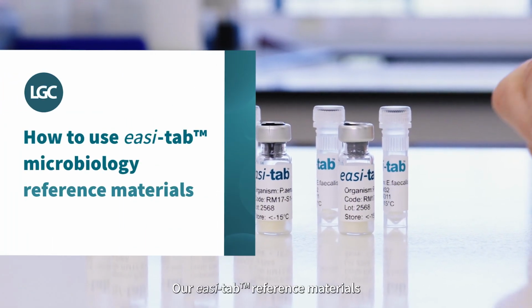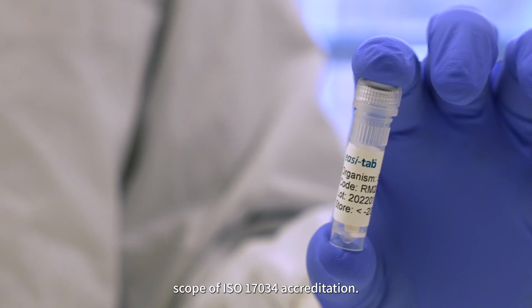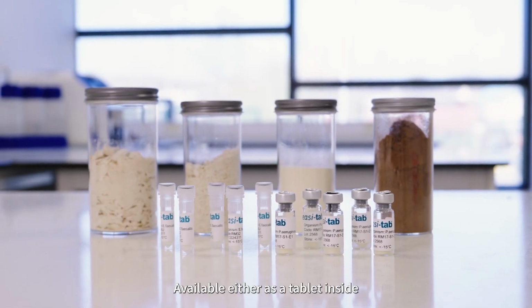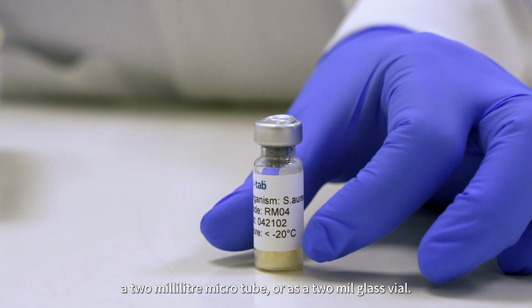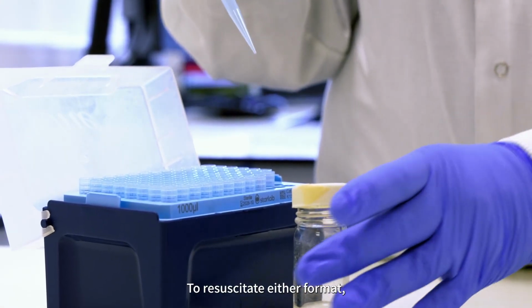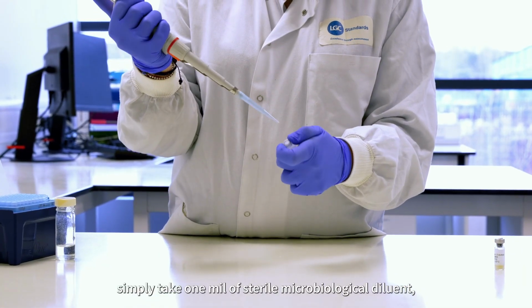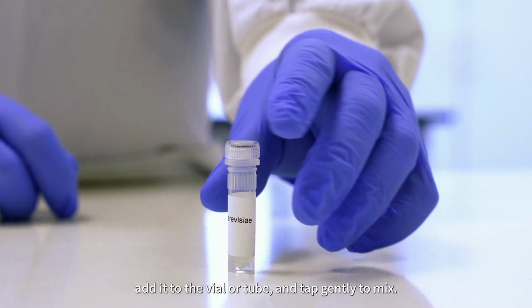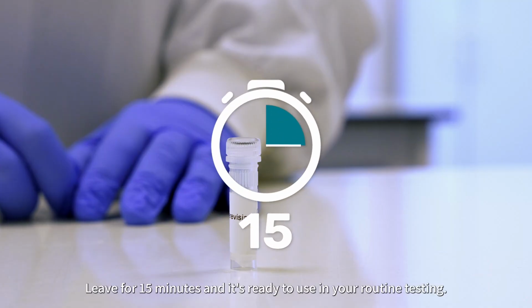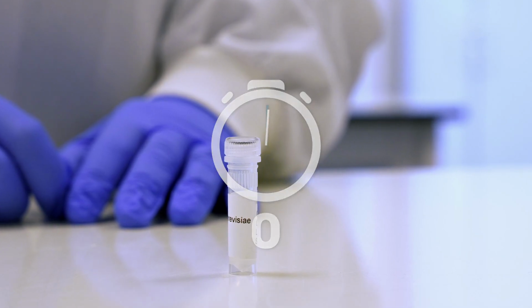Our easi-tab reference materials are lyophilised microorganisms produced under LGC's scope of ISO 17034 accreditation, available either as a tablet inside a 2 ml microtube or as a 2 ml glass vial. To resuscitate either format, simply take 1 ml of sterile microbiological diluent, add it to the vial or tube, and tap gently to mix. Leave for 15 minutes, and it's ready to use in your routine testing.